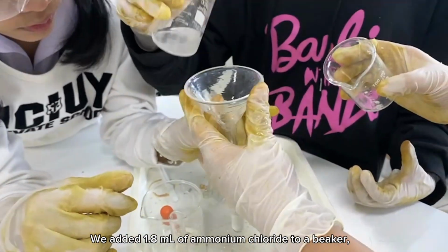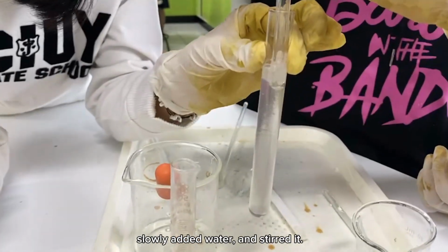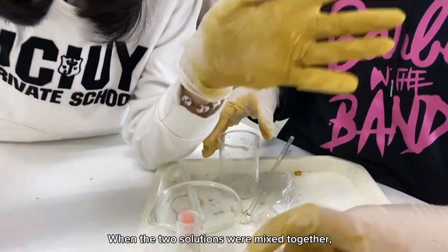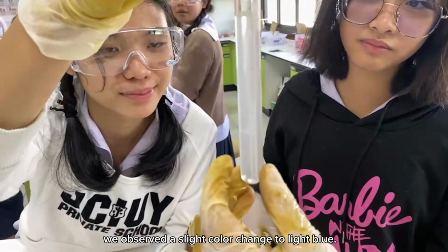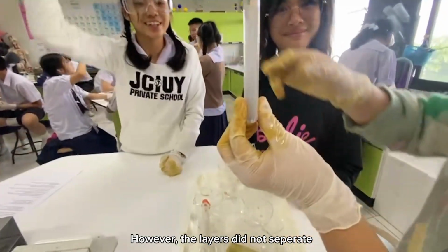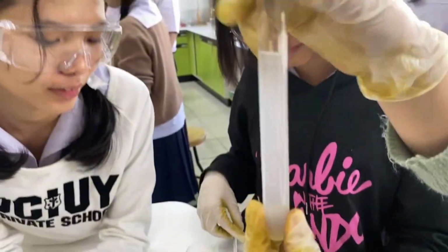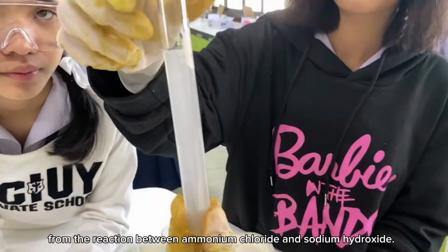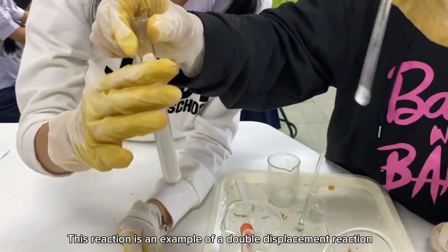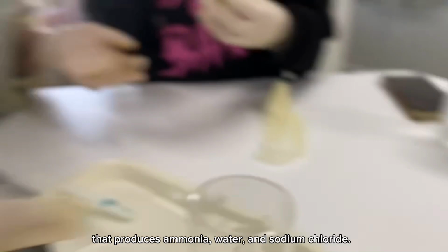We added 1.8 ml of ammonium chloride to a beaker, slowly added water and stirred it. The same process was repeated with sodium hydroxide. When the two solutions were mixed together, we observed a slight color change to light blue. However, the layers did not separate. In this experiment, we observed the release of ammonia gas from the reaction between ammonium chloride and sodium hydroxide. This reaction is an example of a double displacement reaction that produces ammonia, water, and sodium chloride.